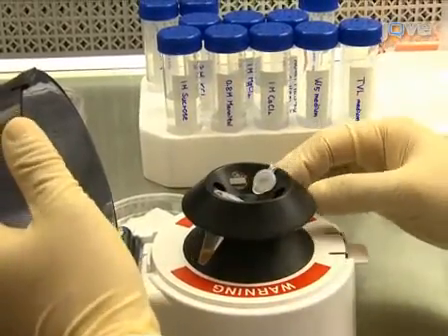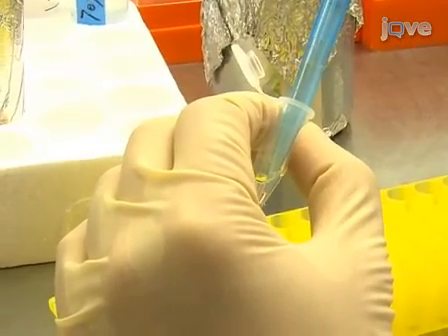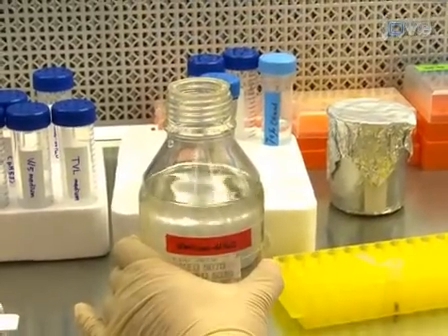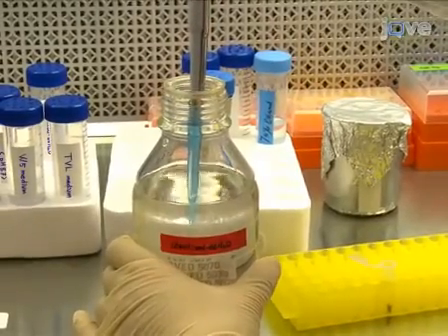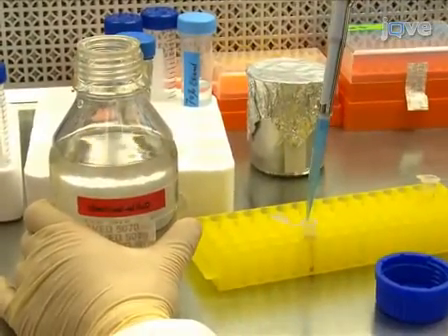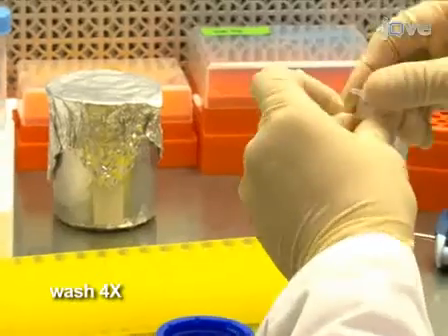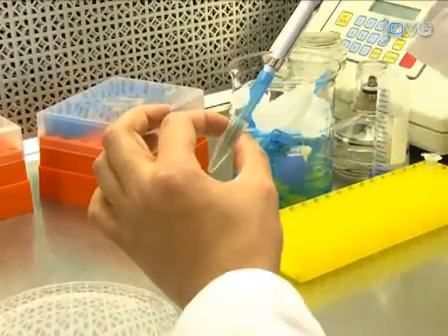To facilitate removing the bleach solution, give the seeds a quick spin down and pipette out as much of the solution as possible. The final sterilization step is done in a laminar flow hood. Add 1 milliliter of sterile water to the seeds and mix well. Give the seeds a quick spin down and aspirate the water. Repeat this water wash four more times. Now that the seeds are sterilized, spread them on the MS plate.